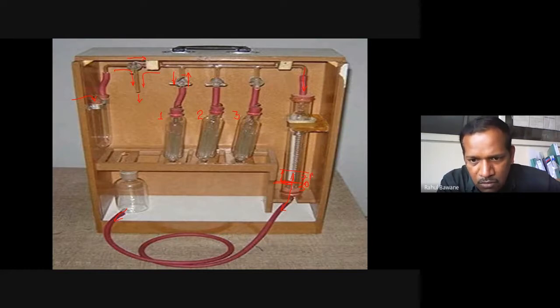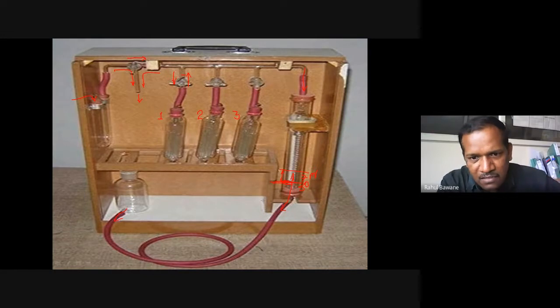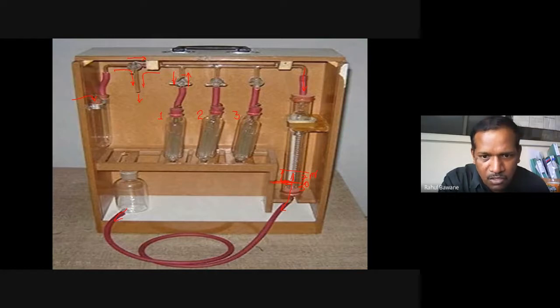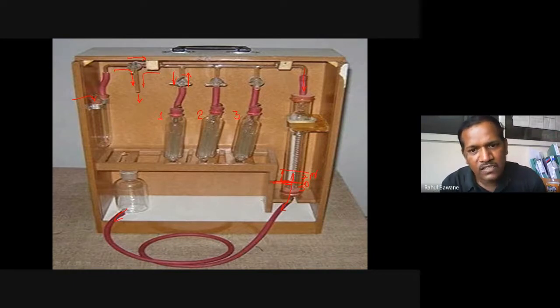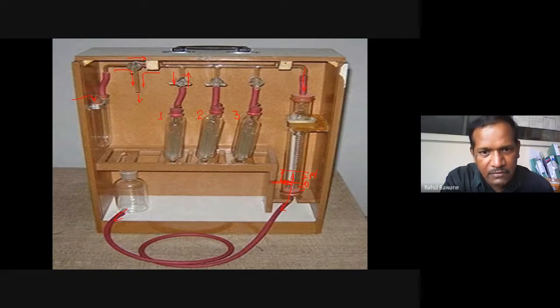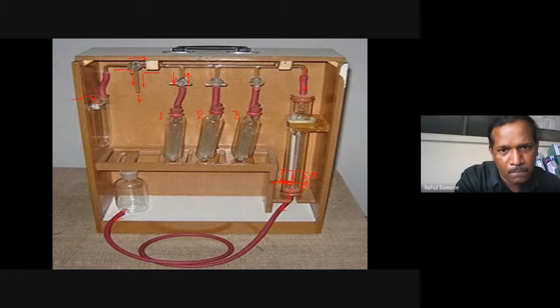The level change in water is equal to the amount of CO₂ absorbed. At the beginning the total gas sample was 30 ml. After the flue gas passes through bulb one and returns, the water level has risen. When we put the leveling bottle back to its initial position, the water level in the burette is lifted — why? Because CO₂ was absorbed, that volume was reduced, creating negative pressure. Suppose the rise is 7 ml, so 7 ml is the amount of CO₂.